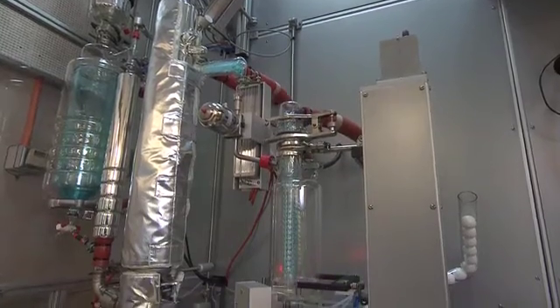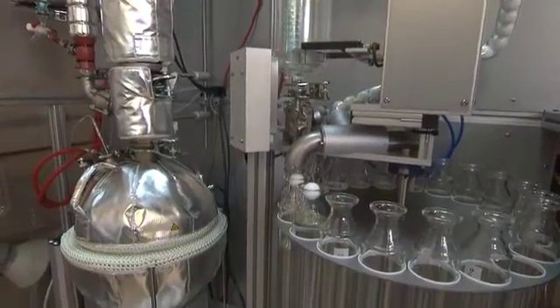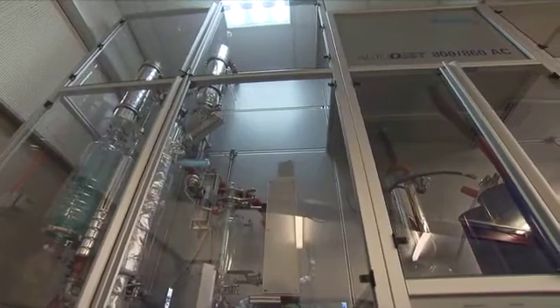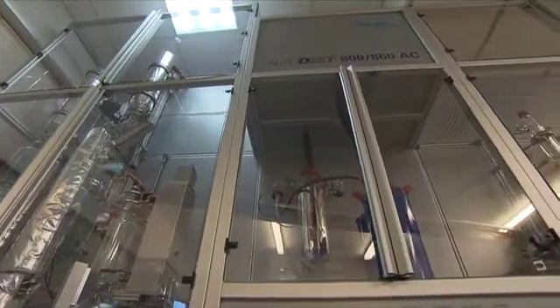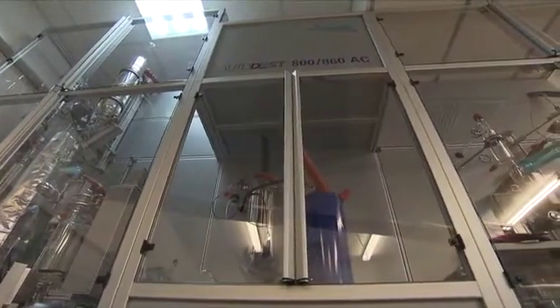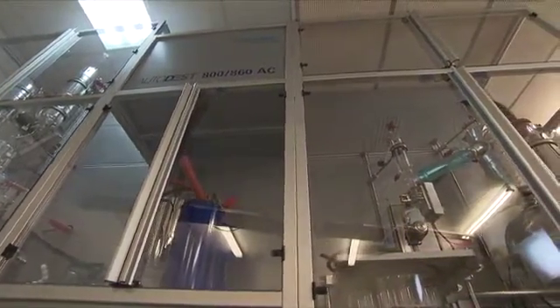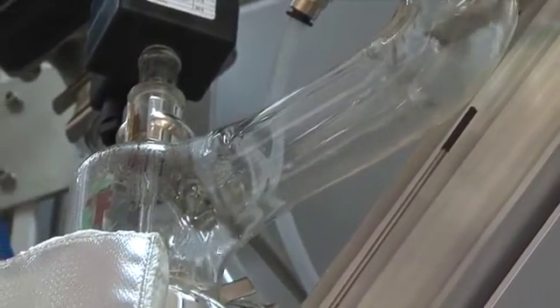The initial phase of an assay involves separating the crude petroleum into a number of defined boiling ranges or cuts through a distillation process. We use test method ASTM D2892 to perform the distillation of the crude petroleum to a temperature of 400 degrees Celsius. Our bigger distillation unit can continue the distillation on the residue product to a maximum temperature of 565 degrees Celsius using test method ASTM D5236. Another key feature of our bigger distillation unit includes a water removal unit.